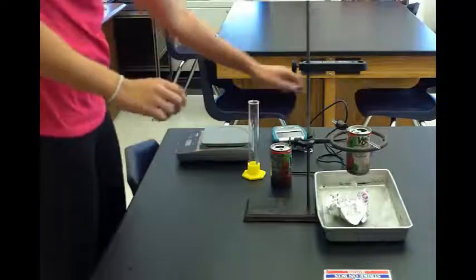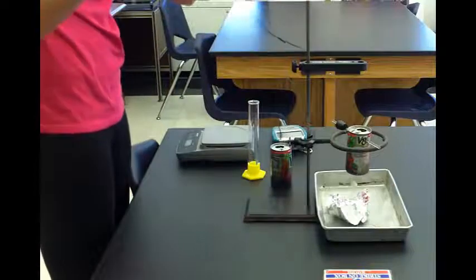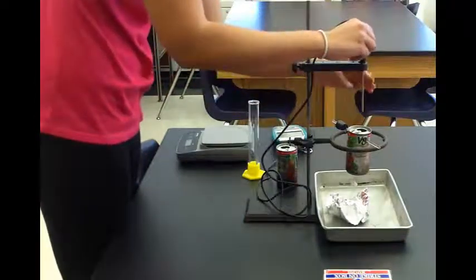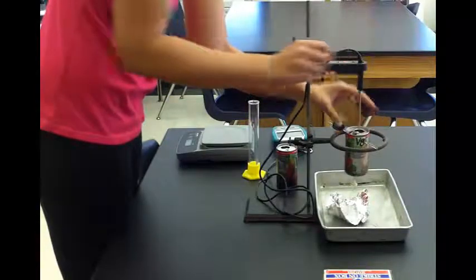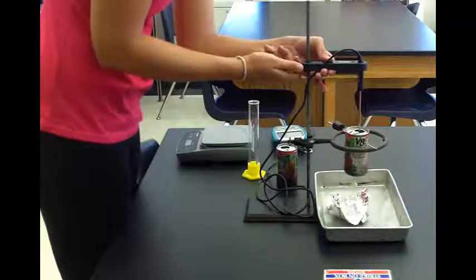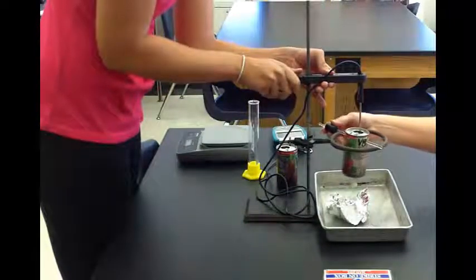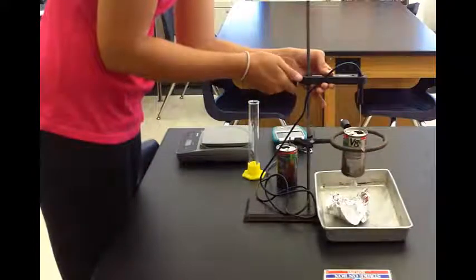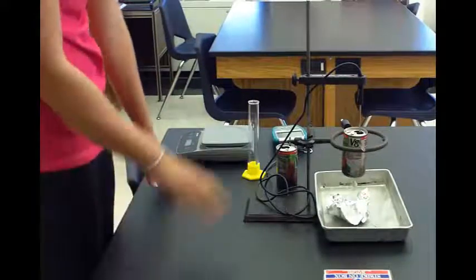Now with your lab quest, plug in your probe to it and wrap the back of it around the stand so it doesn't get in the way. Two people might need to do this—you need to adjust the probe to be in the middle of the can and about the middle of the water too. Just get as close as you can; it's kind of difficult. Once you're done setting it up, take that initial temperature and record it in Celsius.